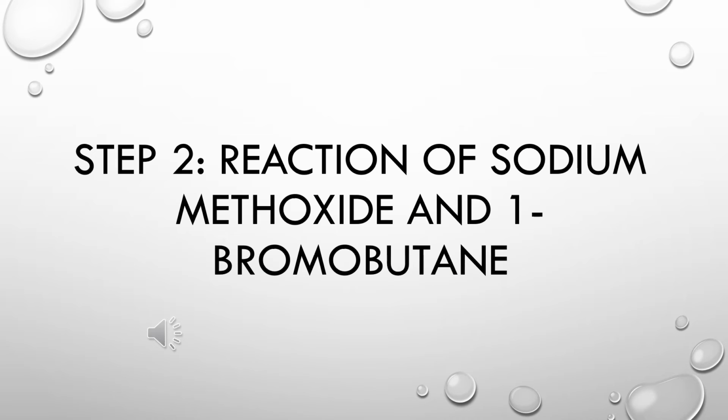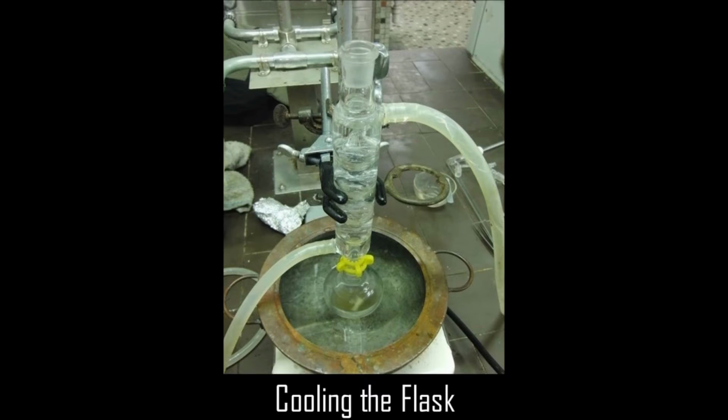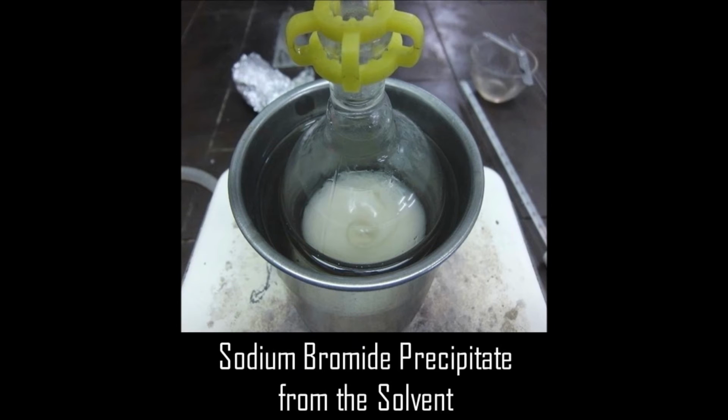Step 2. Reaction of sodium methoxide and 1-bromobutane. Fit the 50 ml round bottom flask containing the sodium methoxide with a reflux condenser. Cool the flask to room temperature with an ice bath. Weigh 5.5 grams of 1-bromobutane into a flask. Using a dropper, add the 1-bromobutane into the reaction vessel through the top of the condenser in 1 to 2 ml aliquots over about a 2-minute period.